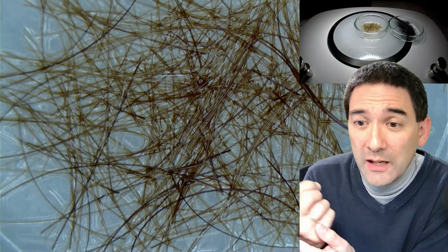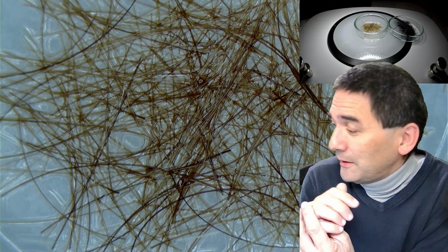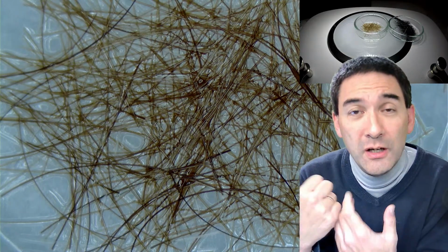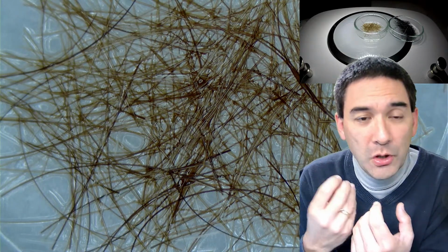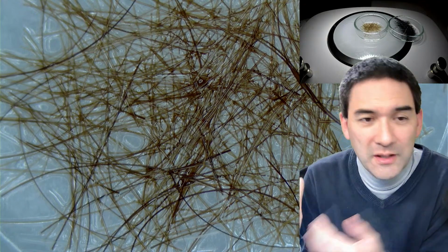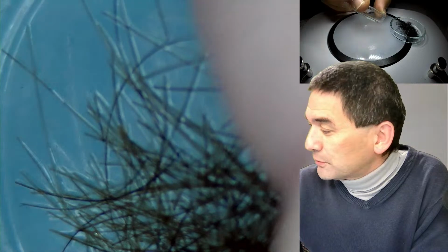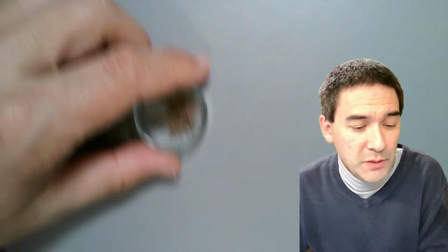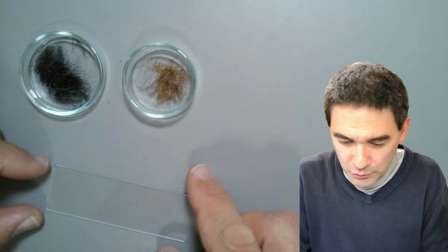So I just want to warn you a little bit, but I simply wanted to demonstrate to you what happens when people bleach their hair with oxidizing agents because it turns the hair brighter, right? And now you can see that over here I've got this brown. I don't know. Should we put this under the microscope as well? Why not? I've not tried this. I'm just gonna make a very quick slide. Why not? Let's just compare them, just for the fun of it.